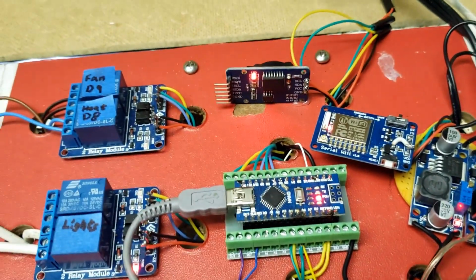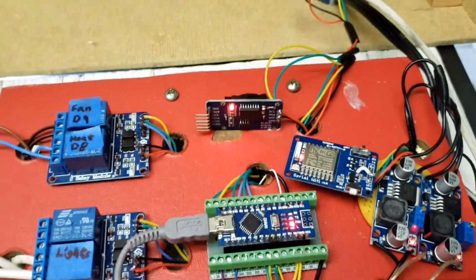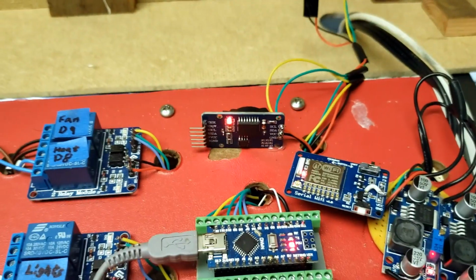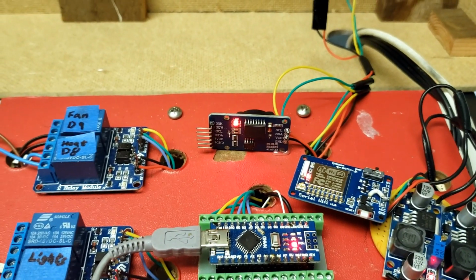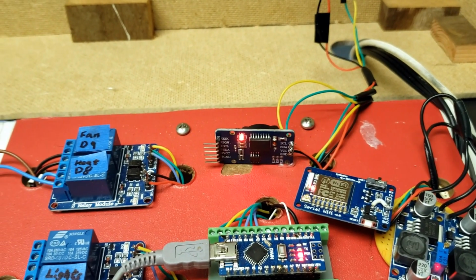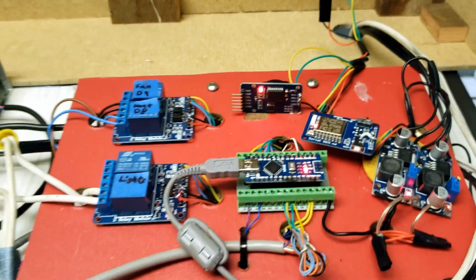Over here, I have the real-time clock, and you can see there's a battery on that. The idea with that is if it gets unplugged or something happens that makes all this shut down, or power goes out, I don't lose my timing. So that will save my time of day, and I can plug it back in, and it will start right up no matter where it's at.